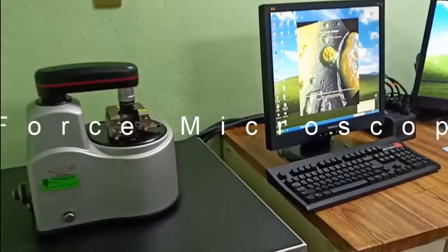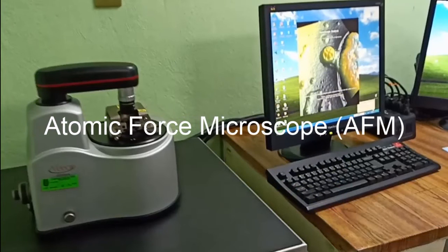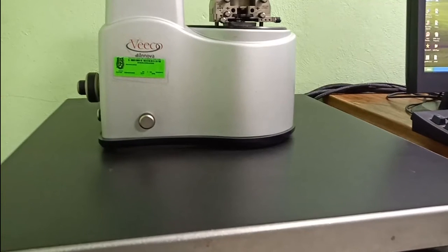And now I want to introduce the atomic force microscope, or AFM. This microscope can be used in different fields of investigation, but particularly in all those fields in which forces in nanonewtons or scanning in nanometers can be used.